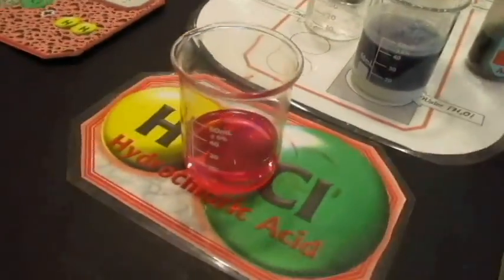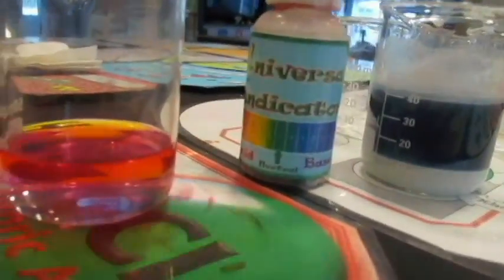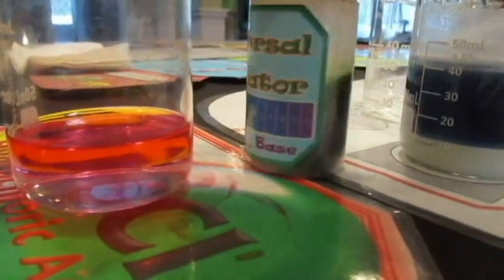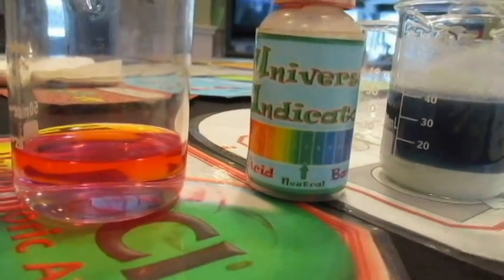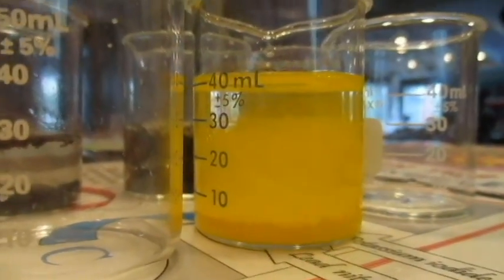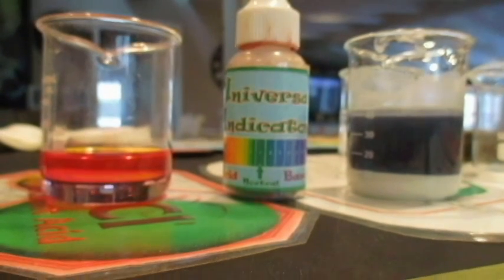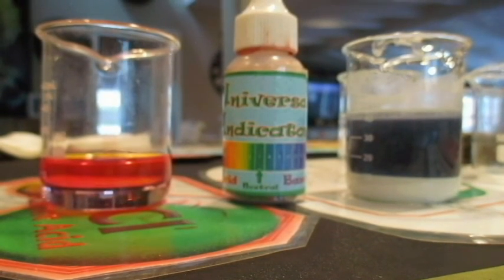Very good contrast here. It's almost like an acid on this side and a base on that side. It's just like the universal indicator colors go there. So I think we've seen enough to be able to determine everything about these reactions. And then along with the demos, you can identify which reaction types that we saw.